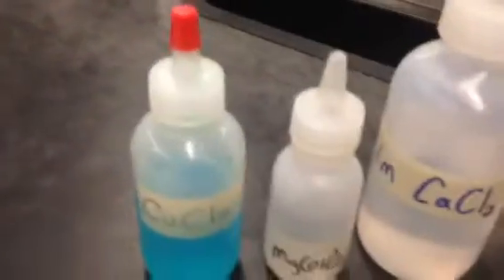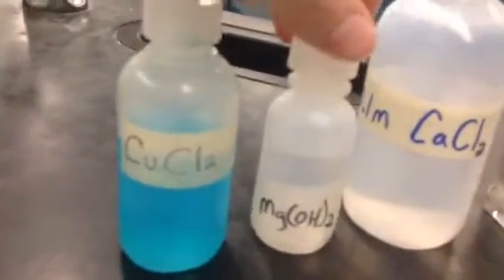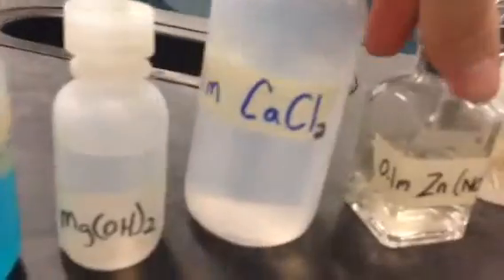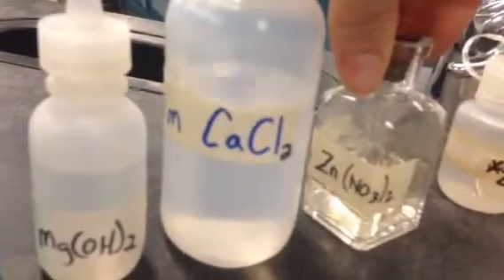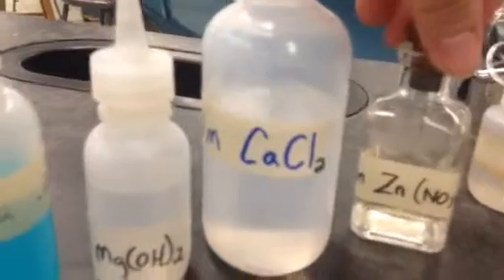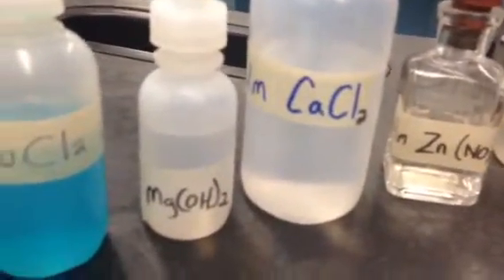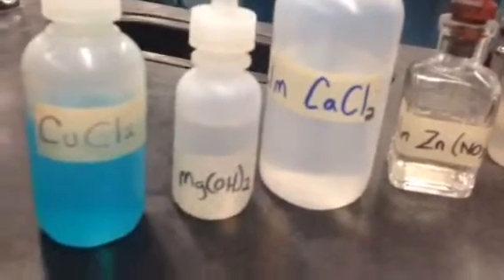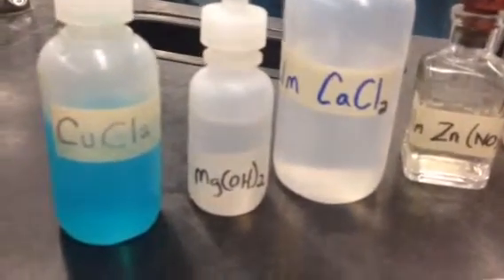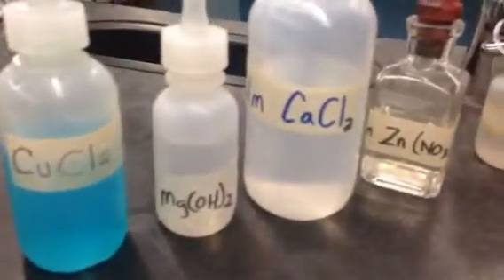Our other reactant is going to be an ionic compound that is in aqueous solution. So those will have AQs next to them. You can see the bottles here with their formulas on them. If you want to copy that down, make sure you get that little 2 on the other side of the zinc nitrate. So these are going to be our ionic compounds we're using, and they are all in aqueous solution. And likewise, the product ionic compound, if a reaction takes place, will also be in aqueous solution, and you have an AQ next to its formula.